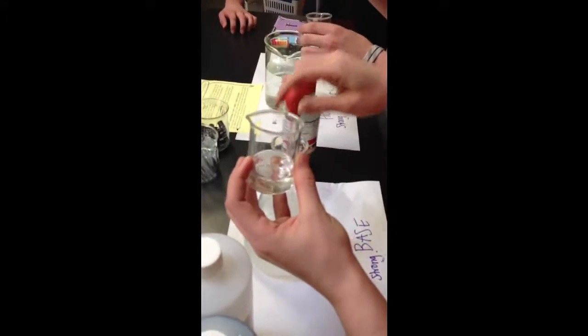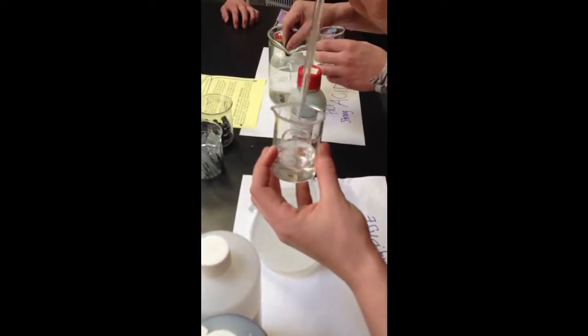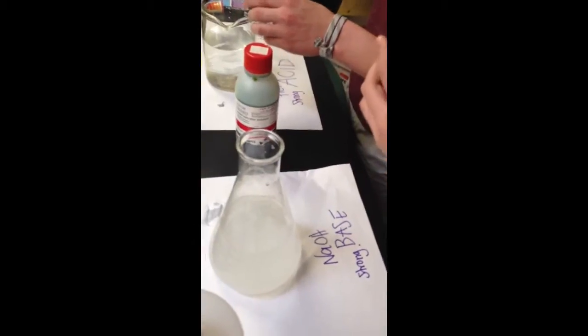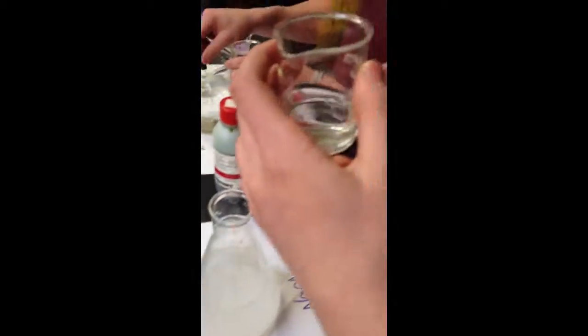We need more acid. There's more acid right there. I don't like that. Just however much you think. How much are you filling it? I don't know. Fill it up to the 40.